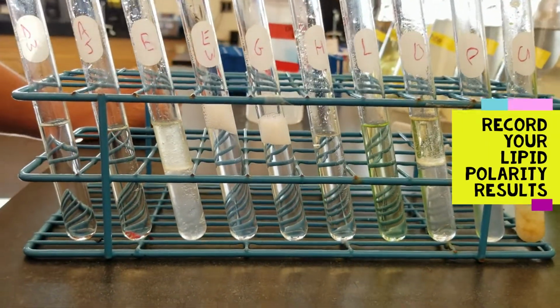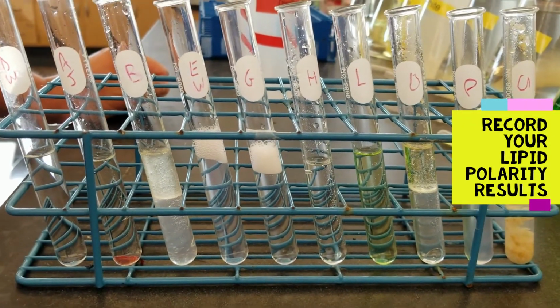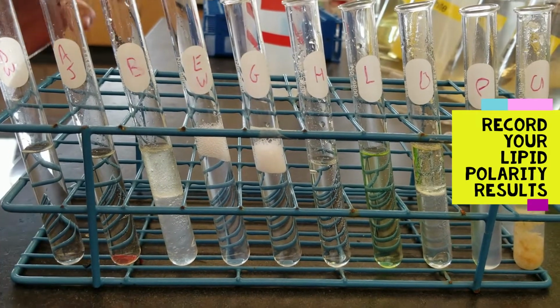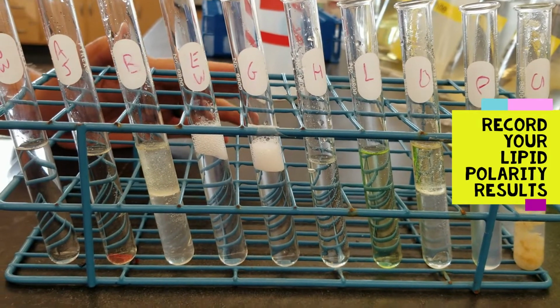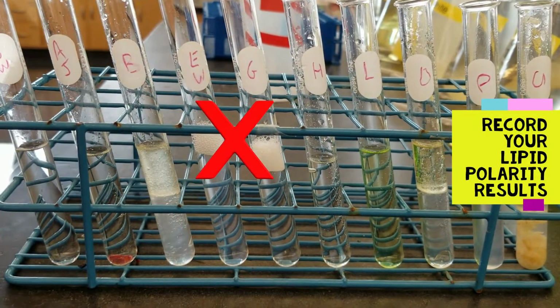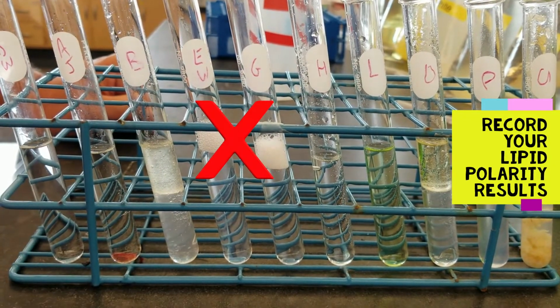As you're going from sample to sample, you want to look for a distinct layer above water. For these two right here, the egg whites and the gelatin, you see a foaming action that took place above the solution. That is not a layer of fat that you need to be worried about. That's just some foam, and if we gave it time, it would probably settle down.